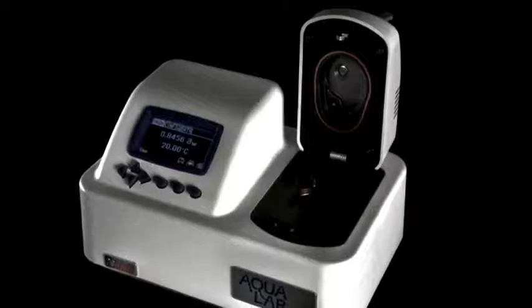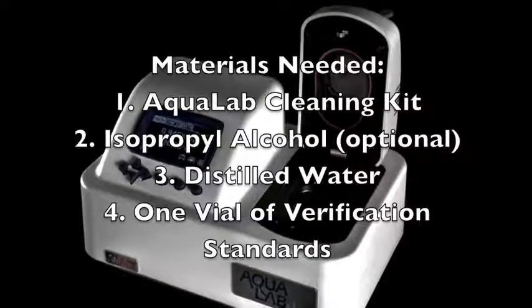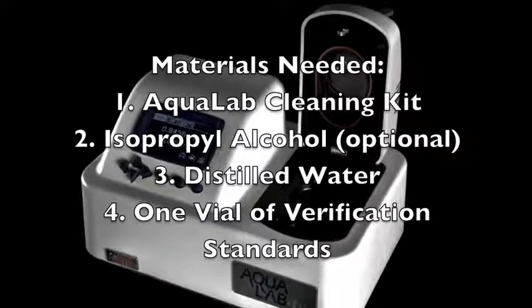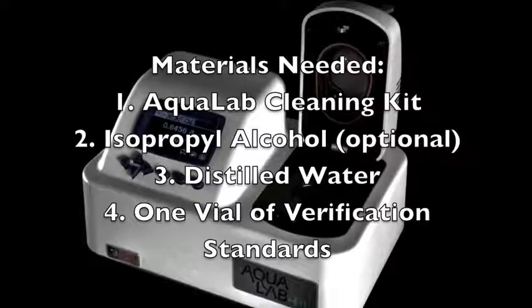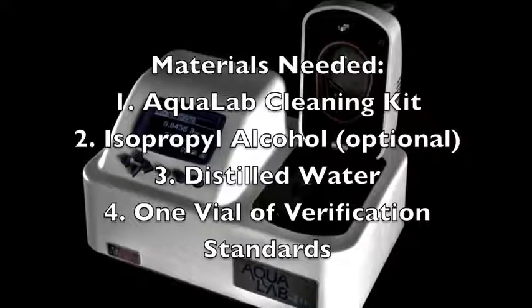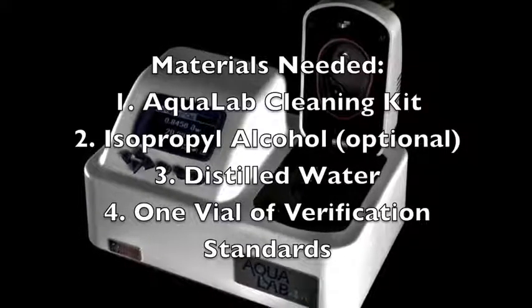In order to clean your Aqualab, you'll need the materials listed here on the screen. Note that isopropyl alcohol may be used in place of cleaning solution in the following process. Isopropyl alcohol can be particularly useful when trying to remove greasy substances from the block surface.